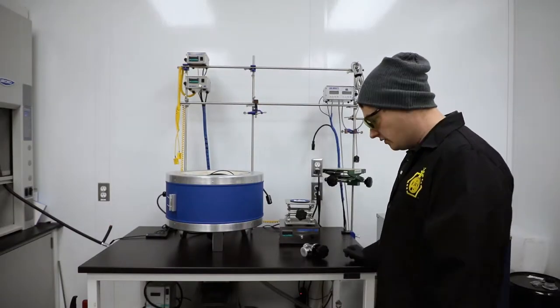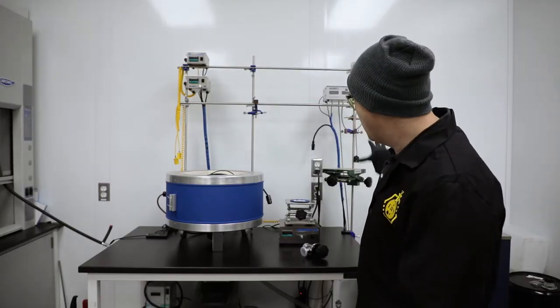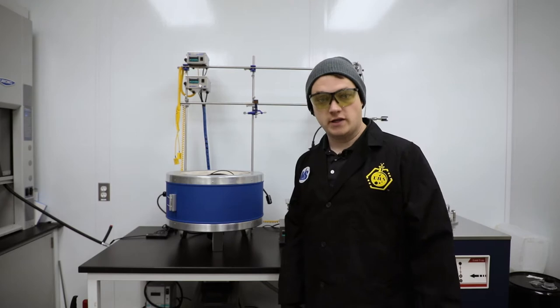So today what we're going to do is connect this vacuum pump to the AIT80X cold trap and then eventually to our 20 liter G3X system.